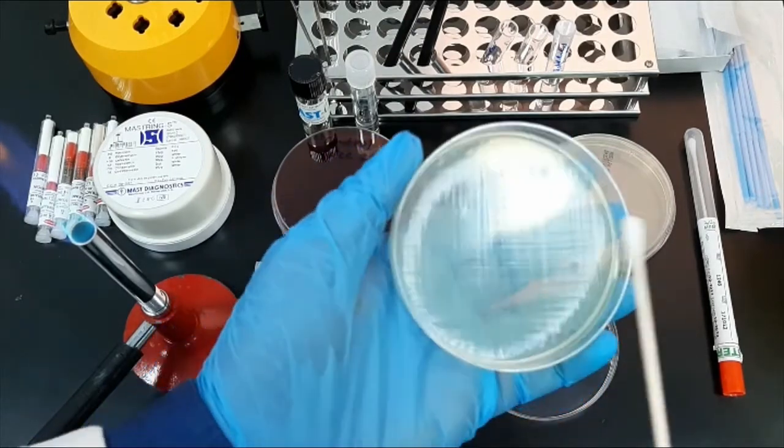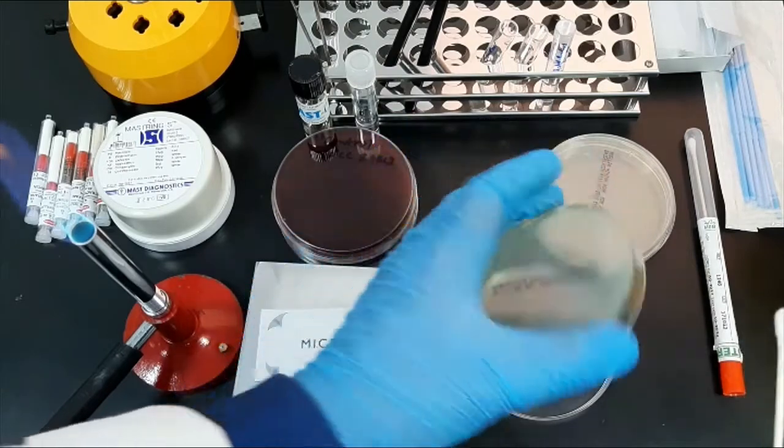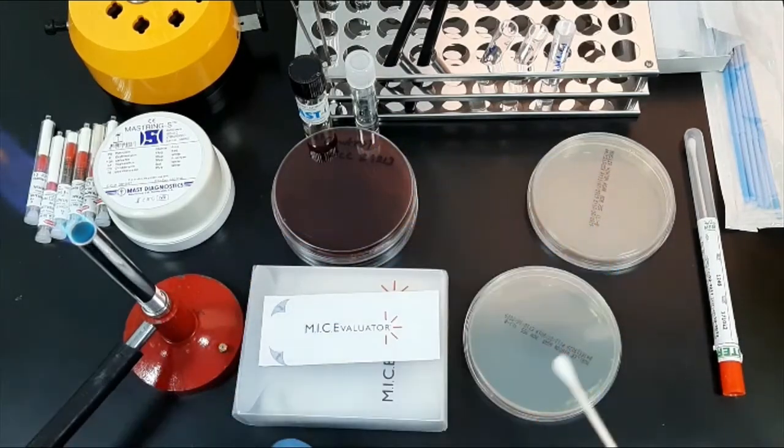Once you finish the inoculation, close the plate and discard the swab in the discarding container.